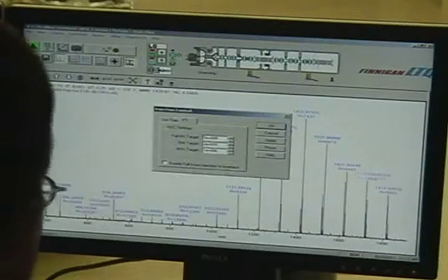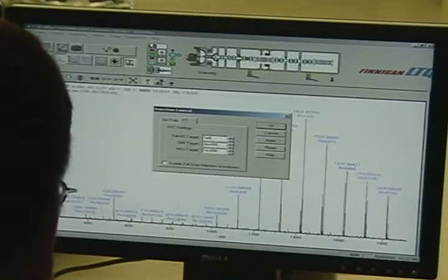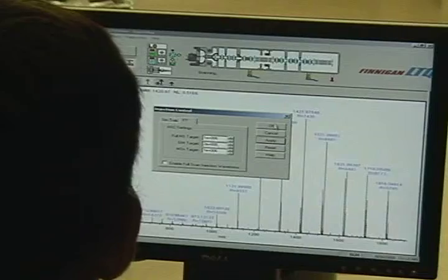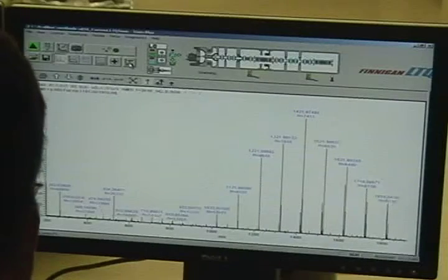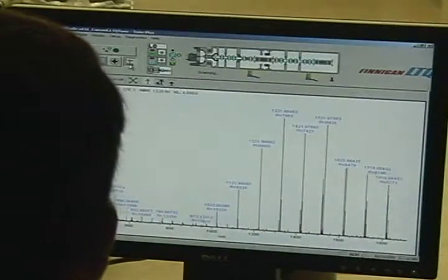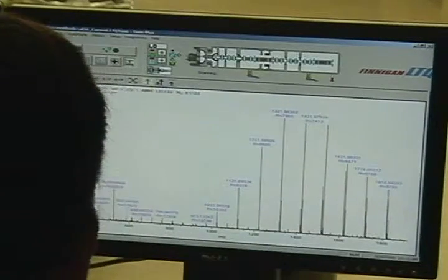Now let's go up to 1E6, where you've been running, which should take my IT time 2x. Right? We double the number of ions. And we're not IT limiting. Right, we're not IT limiting. Without averaging turned on, don't do mass measurements. We always want to have averaging.